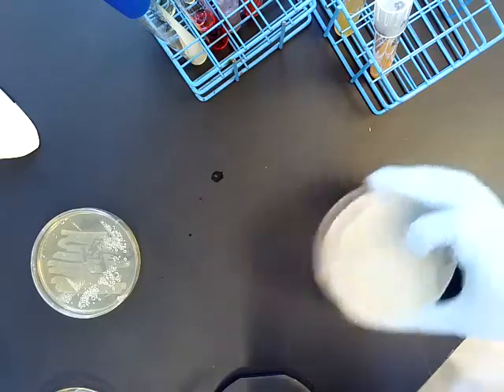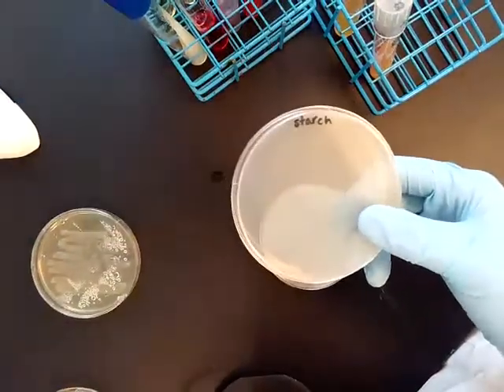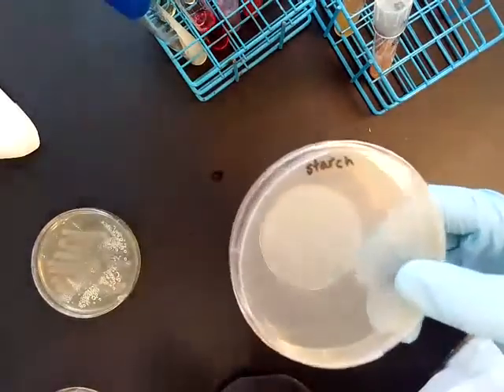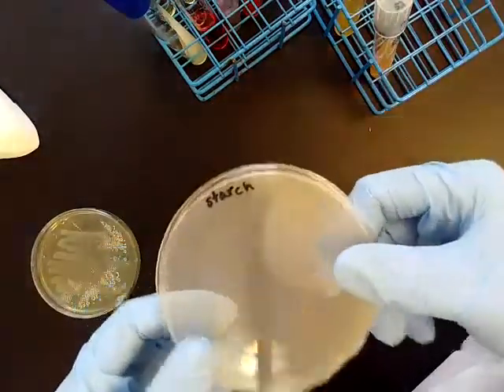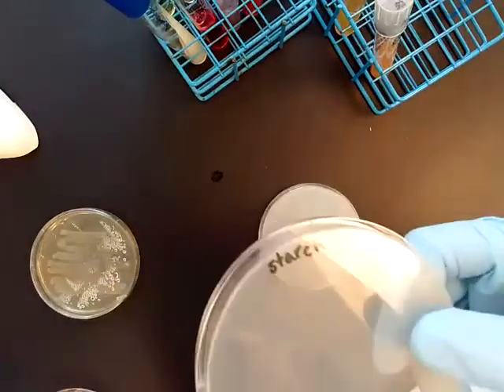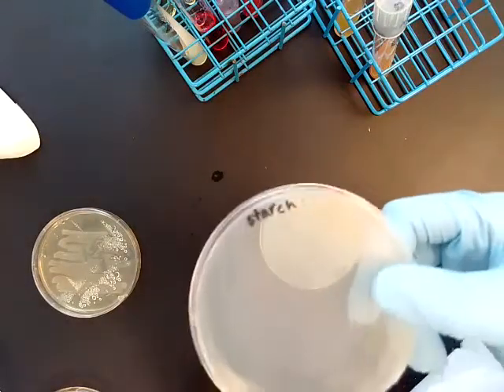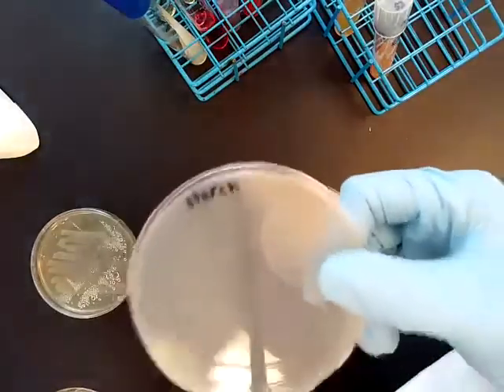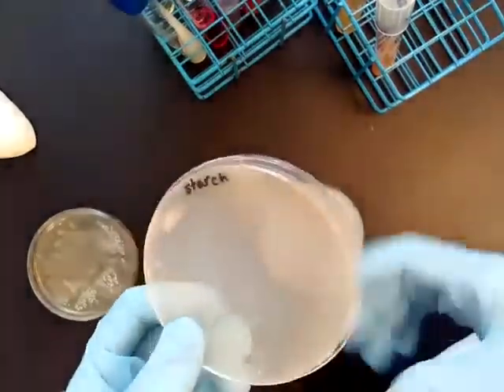The first test is starch hydrolysis. There's starch in this plate, and if the microorganism produces the enzyme amylase, it will be able to digest the starch in the medium. We streak two lines of growth on the plate and incubate it. After incubation, we add iodine, because iodine forms a complex with starch — it'll be dark where starch exists and clear where starch has been digested. A positive result shows clearing around the growth after iodine is added.